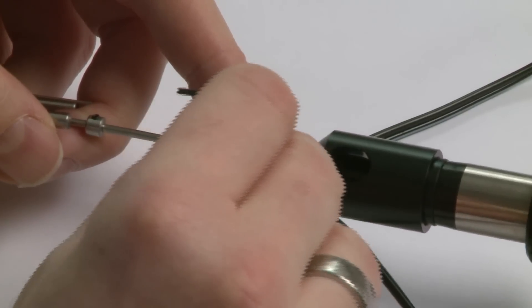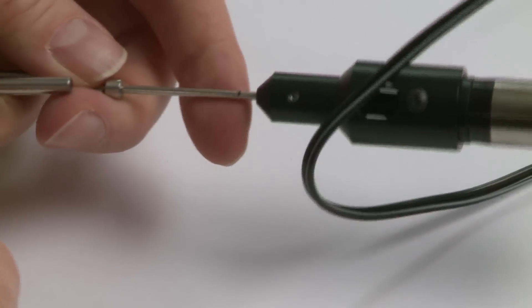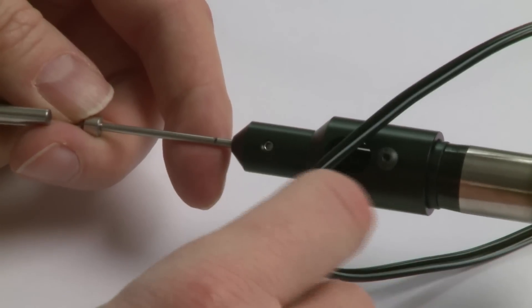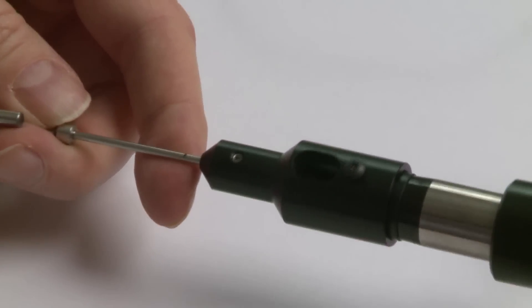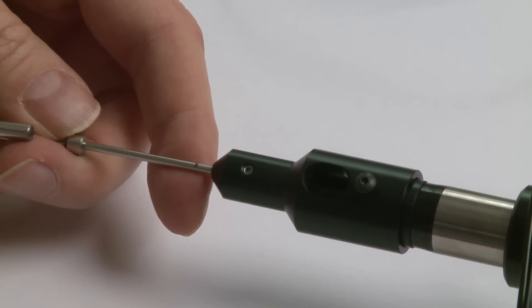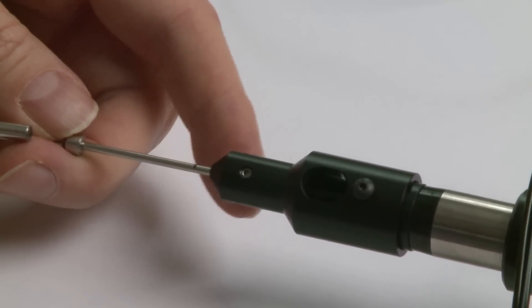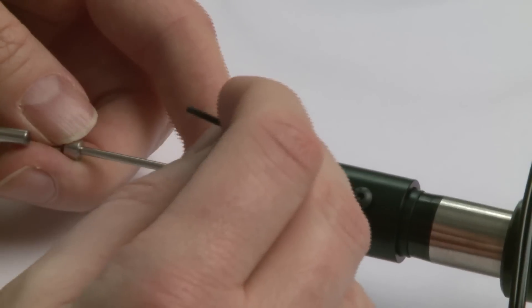And therefore you have to unscrew the holder that tightens and defines the position of the motor right onto the shaft.